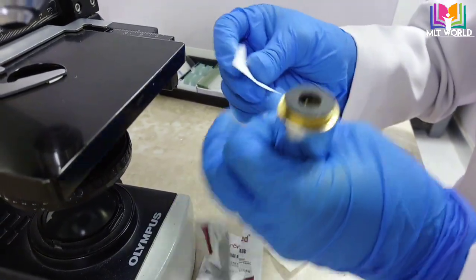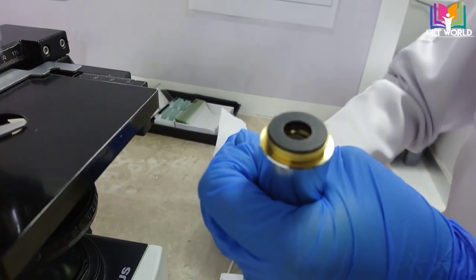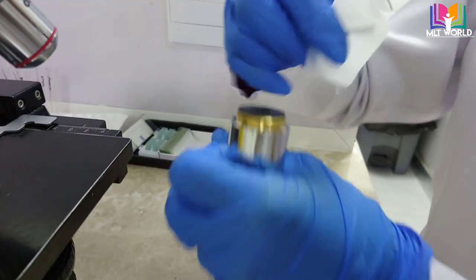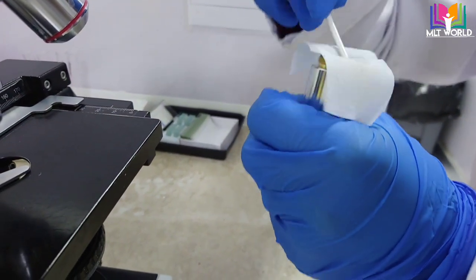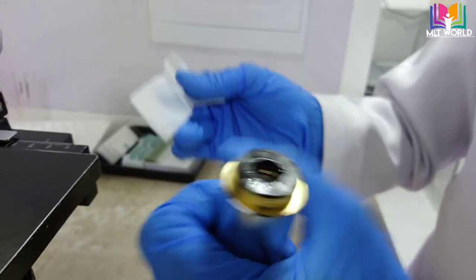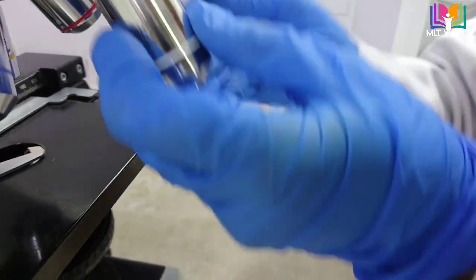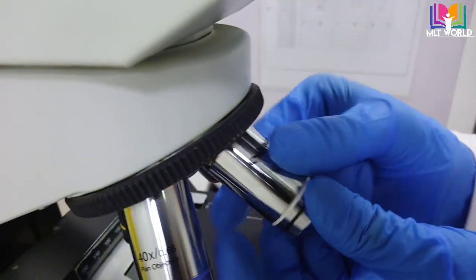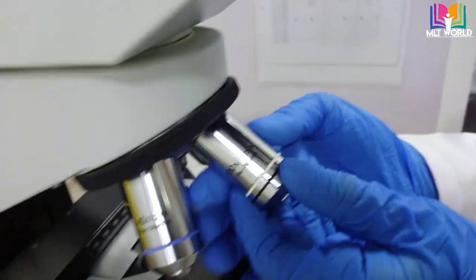And same way, we will clean the lens from inside. Later, I will show you one more area of the microscope that we can clean.